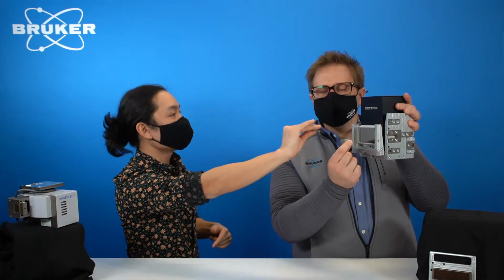Okay, so there's a couple of ways that you could think about this, right? If we look at the EIGER and we're talking about the active area here, the maximum capture angle is going to depend on what direction you're defining. So is it in the 2 theta direction or is it in gamma? As well as how close is your detector to your sample. The closer you are to your sample, the bigger that angle looks. The further away you are, the tighter your achievable resolution.